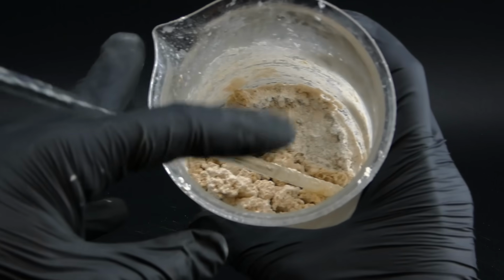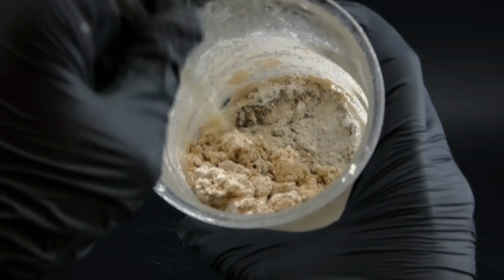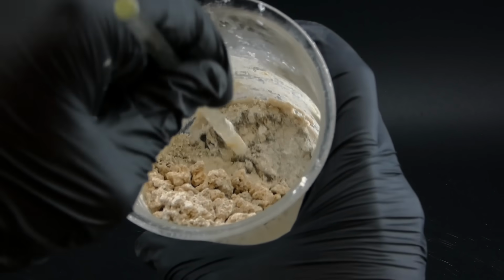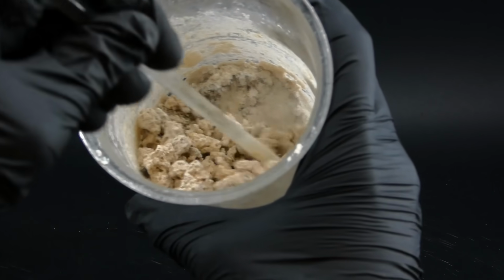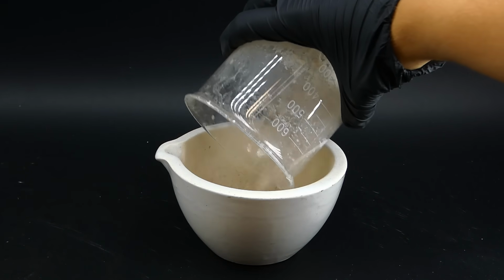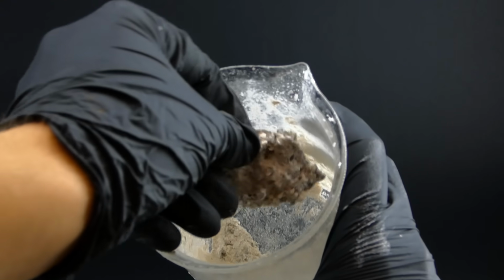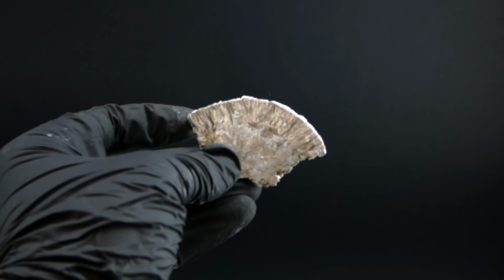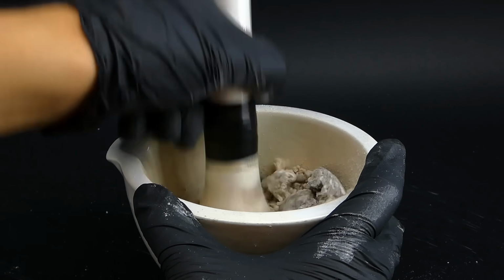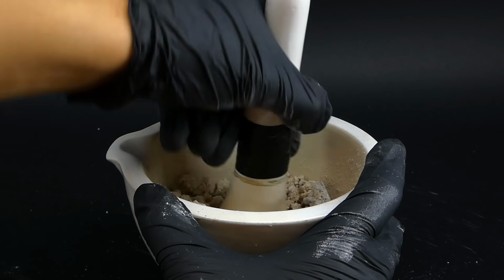There were a lot of large chunks of some fluffy and brown sodium acetate and the brick on the bottom that I will have to somehow get out. I decided that it would be a good idea to grind these chunks down to a powder using my mortar, so I got them all inside and managed to scrape the solid layer from the beaker using a metal spatula, and the crystals that formed in it looked really nice. I then ground everything into a coarse powder. The sodium acetate was really fluffy and brittle, so it wasn't too much of a problem.